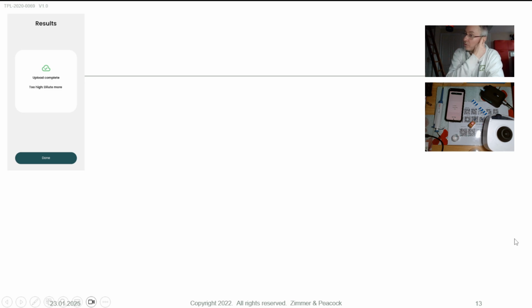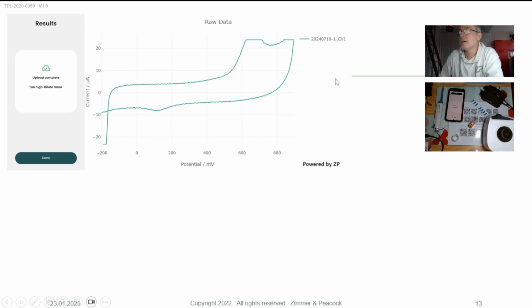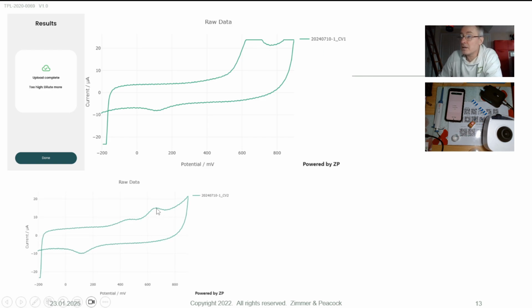So I think later on they tested, they say the same sample, but when they do this one, they get upload complete, too high, dilute more. So upload complete means the data went to Djuli. Too high means there's essentially too much capsaicin in that sample, and dilute more. And again, they've got a Djuli premium account along with their Sense It All, FoodSense Generation 4, and I can see that is an intense peak. There it is. It's flat, and then there's their peak 1, their peak 2, and their peak 3. So apparently they tested the sample earlier on, there was no capsaicin in it. And then they test the same sample later on, and there is capsaicin in it. That is a very, very unusual circumstance.